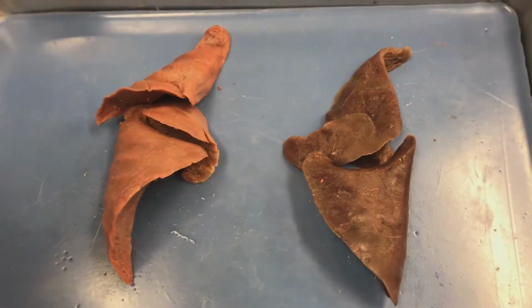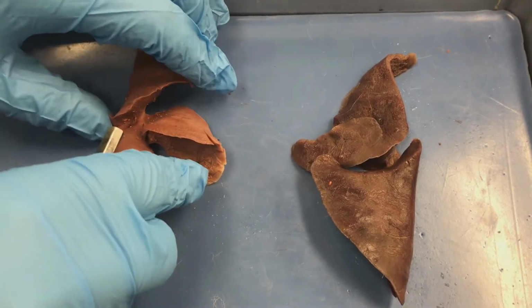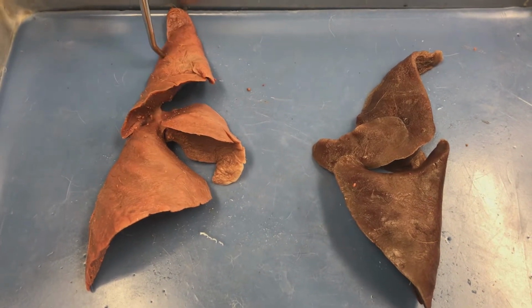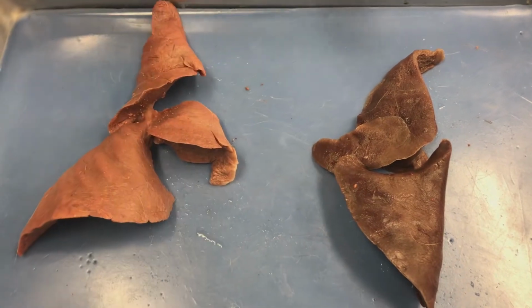It's broad, and that sits on top of the diaphragm, both on the left and on the right. But what makes them different is going to be the different lobes. So both in humans and in cats, they have different lobes. Your right lung here has 3 different lobes: superior, middle, and inferior. And you'll notice that they are completely all separated.